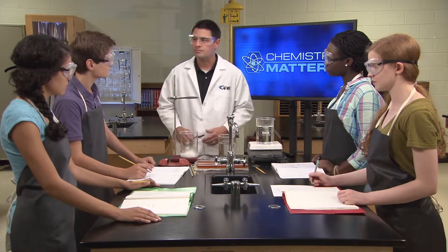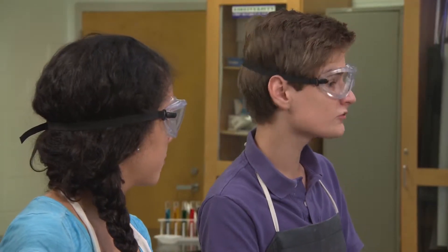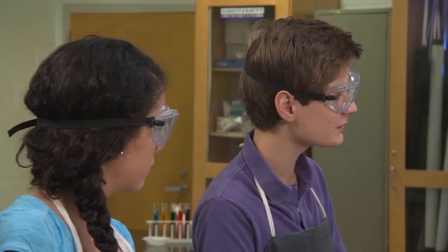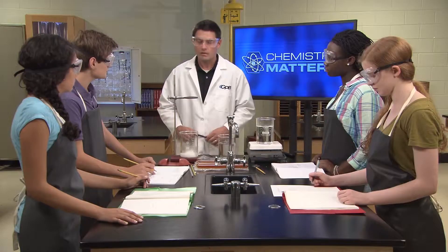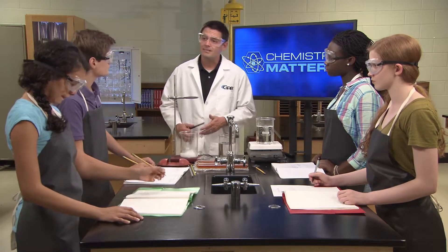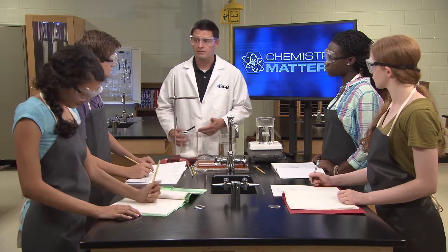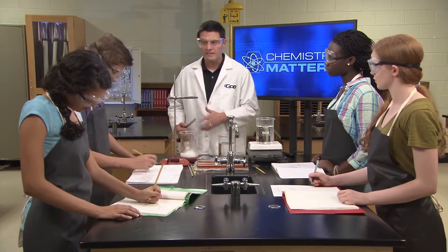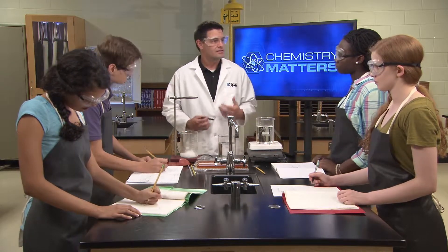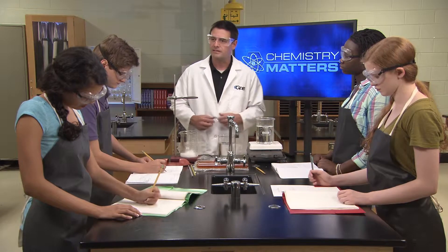What data do you guys plan to collect? We're going to describe the color of the gases at each temperature. That's a good start. You'll need data to back up any conclusions that you make. So you want to think carefully about recording your data so that it will help you support those conclusions at the end.